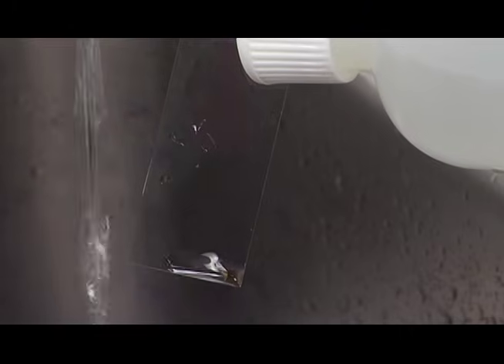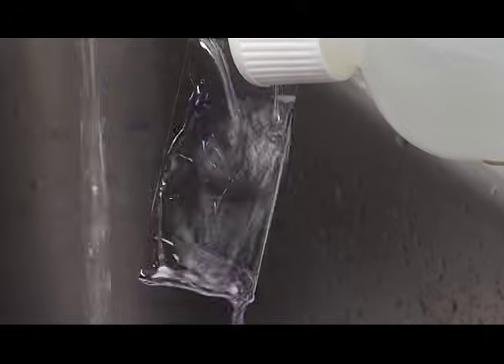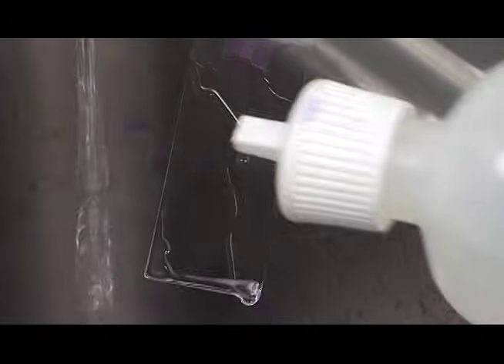So now we're going to come over with the decolorizer and see how it streams out, and then just rinse it off right away.